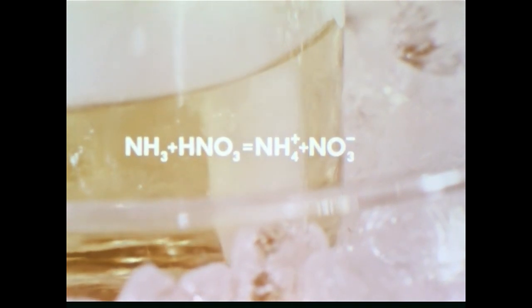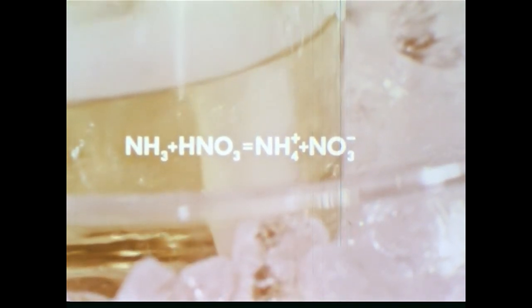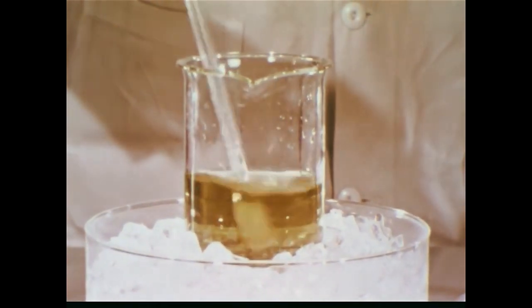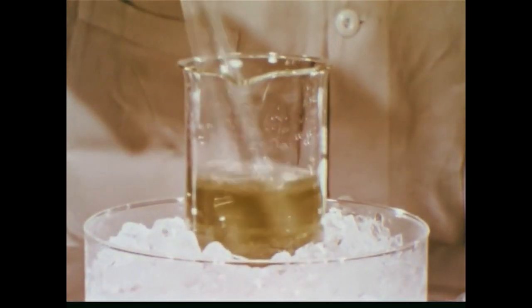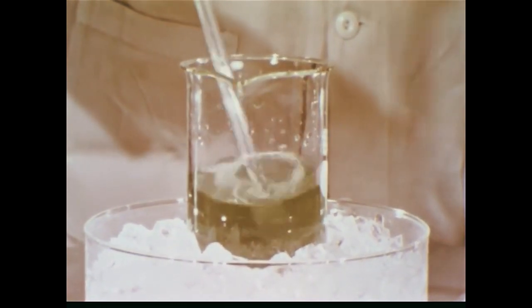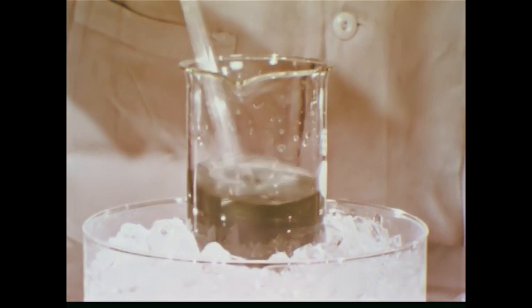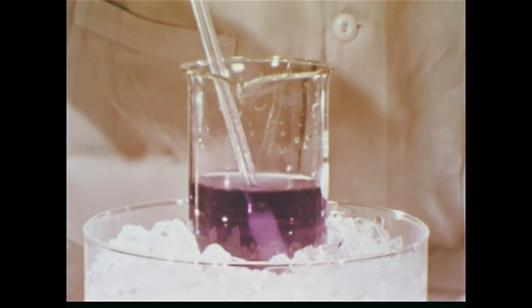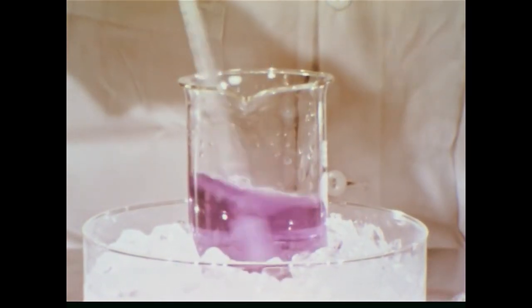The white smoke — solid ammonium nitrate — forms when gaseous ammonia and gaseous nitric acid react above the solution. The net reaction is ammonia plus nitric acid gives ammonium nitrate. But most of the reaction occurs in the solution, forming aqueous ammonium ions and nitrate ions. As more and more ammonia is introduced, the acidity continues to drop. The methyl violet changes through the intermediate colors, finally becoming violet.